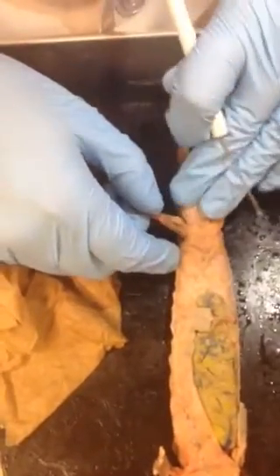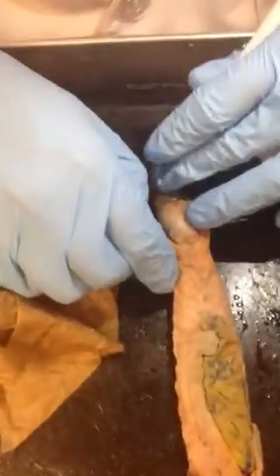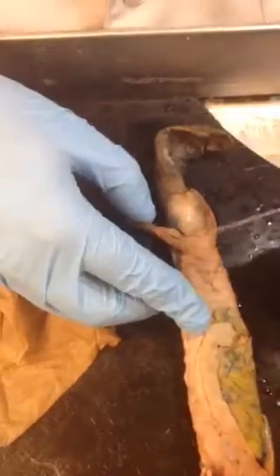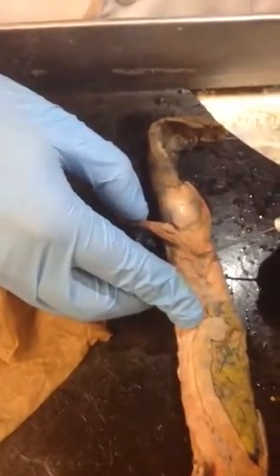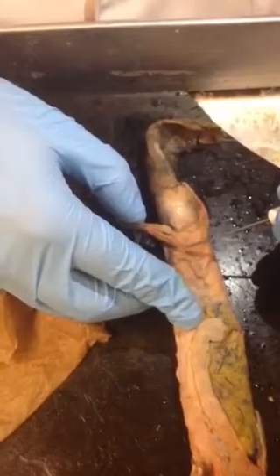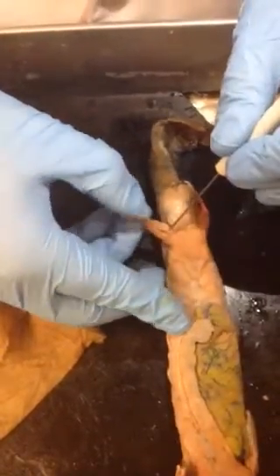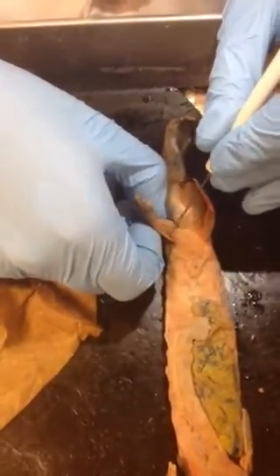Now, this looks tough because there's a bunch of muscles here, but it's not so tough at all. We're going to start with this big triangle here. It comes down here, triangle there, triangle there. This is pubo-ischiofemoralis externus. The pubo-ischiofemoralis internus. This one right up here.